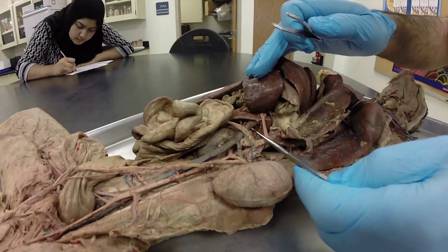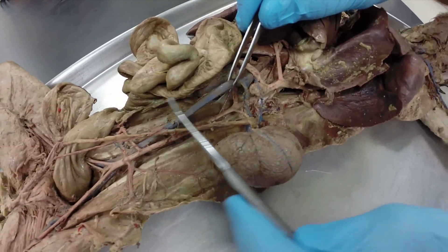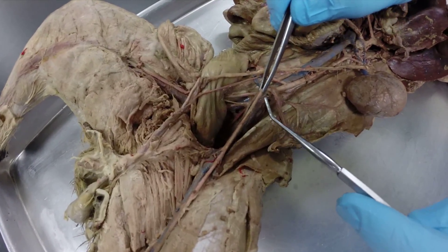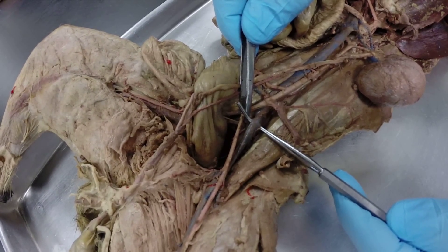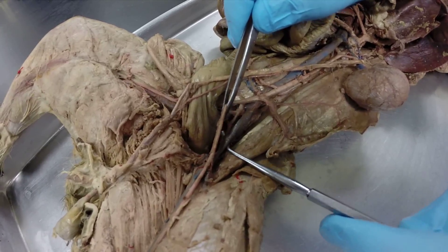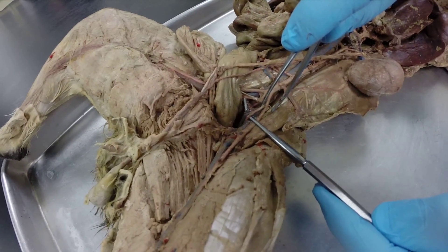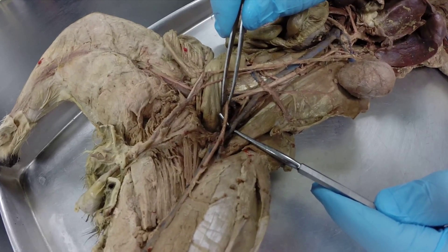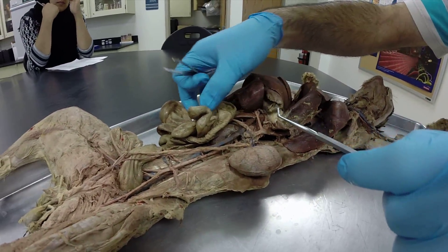Here is our post cava. Coming off it we have our adrenal lumbar vein and our renal vein. Continuing down the post cava, we have the iliolumbar vein left and right. Then the post cava branches into the common iliac veins. The common iliac vein then branches: the small branch is the internal iliac vein, and after that branch the common iliac continues as the external iliac vein, which then continues out across the leg as the femoral vein.